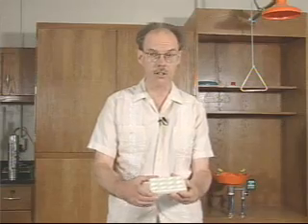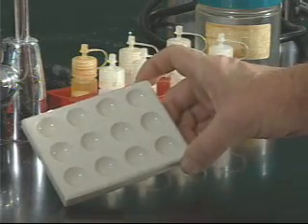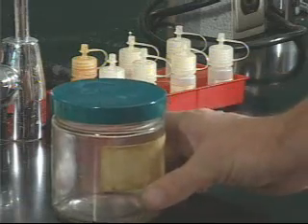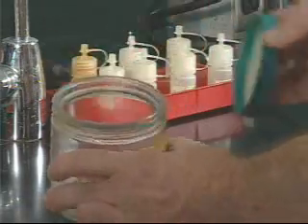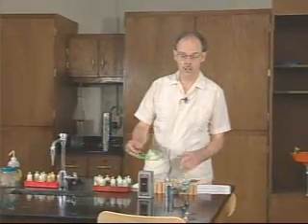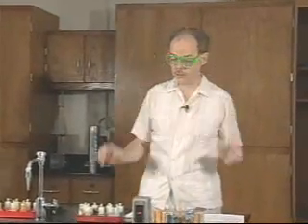And we have a porcelain spot plate, which we can use also to carry out our reactions in. In addition, in front of us we have a hot plate containing hot water, and we have a waste container to put our waste products in. And we also have a set of goggles for safety — I'll put these on now, which you must do also in your experiments.